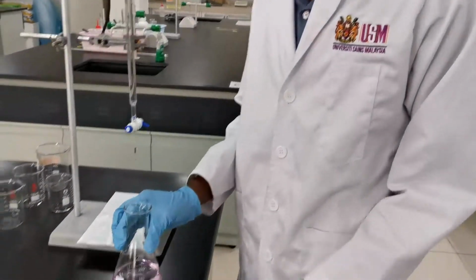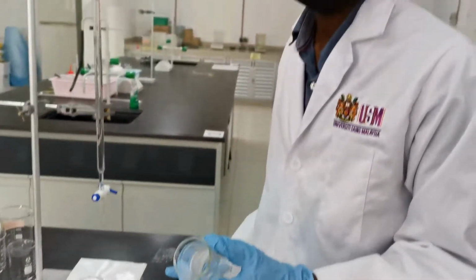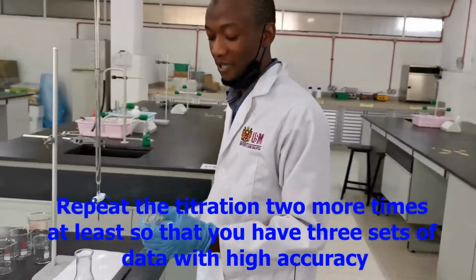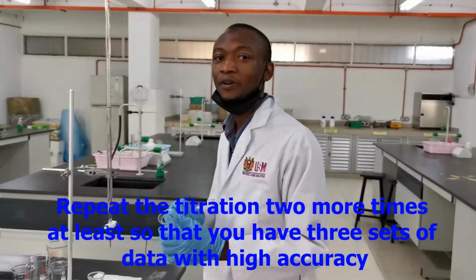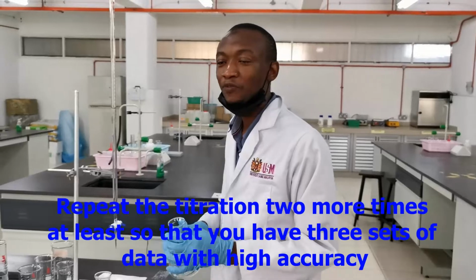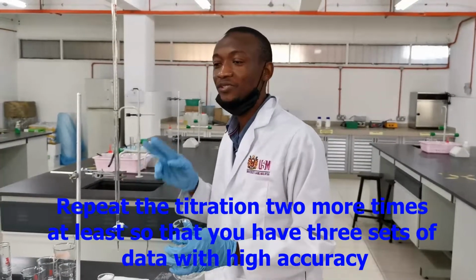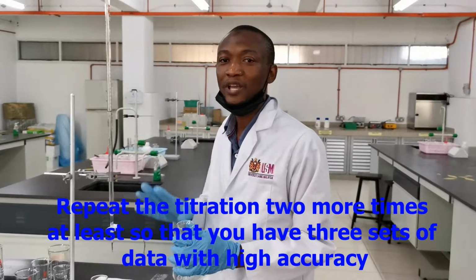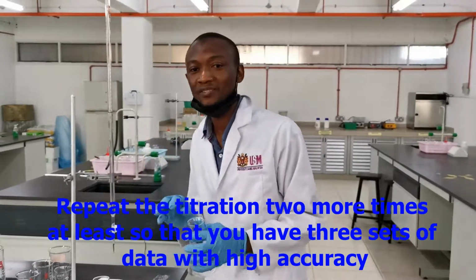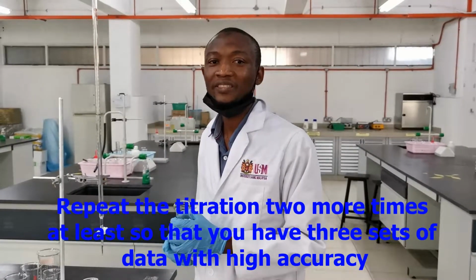To obtain this, you have to repeat the experiment with 2 more sets. Means you weigh another 0.4 gram, add 100 ml of water, and repeat the titration. So you do it 2 more times so that you can have 3 sets. From there you can get your titer value. Thank you. We will move on to part B.